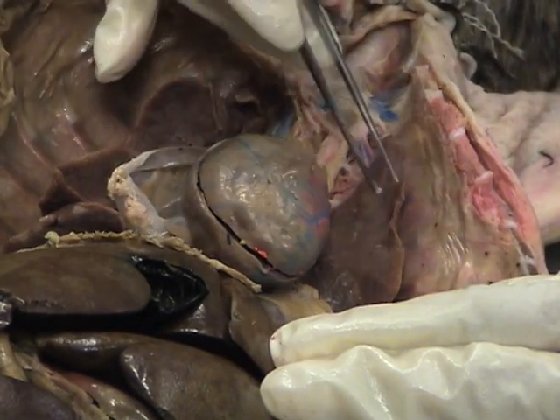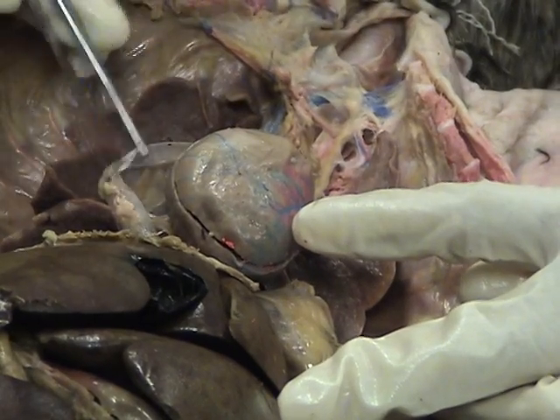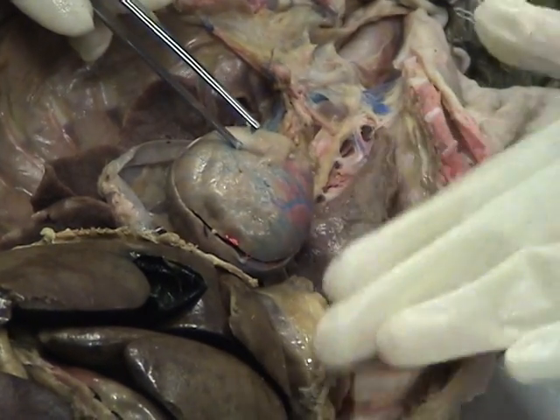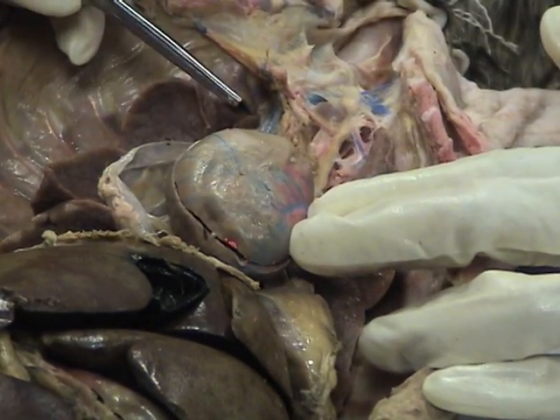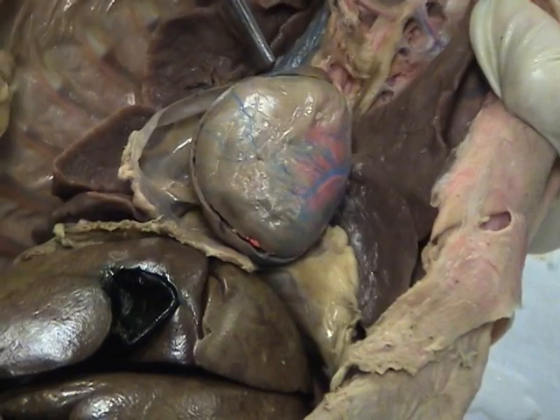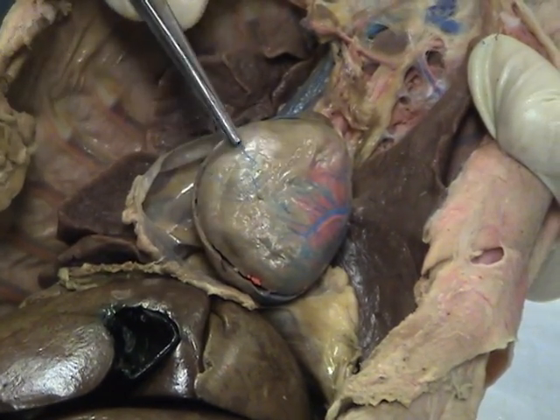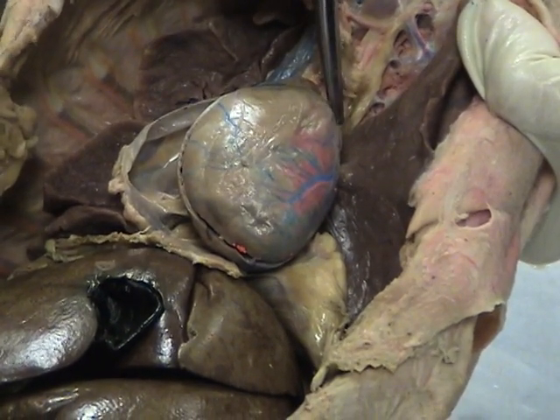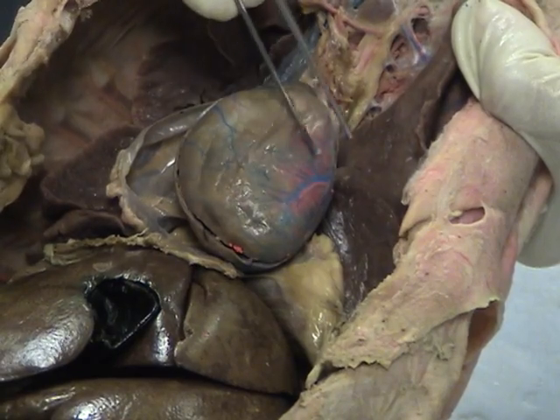The sac holds the heart, and in this view, everything on this side would be the right side of the heart, and everything on this side would be the left side of the heart. So the atrium would be up here — here we have the right atrium, and here would be the right ventricle. The left atrium is a little bit hidden, but it would be approximately here, and all this would be the left ventricle.